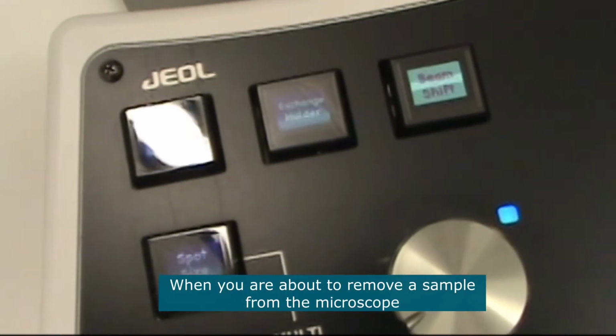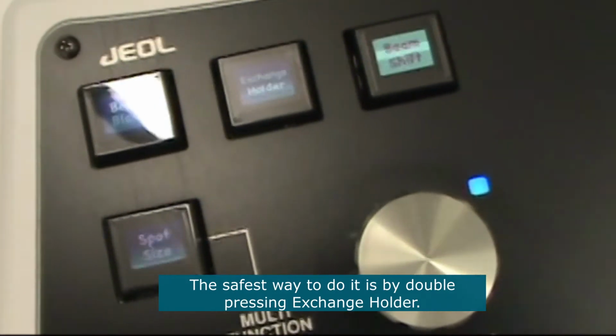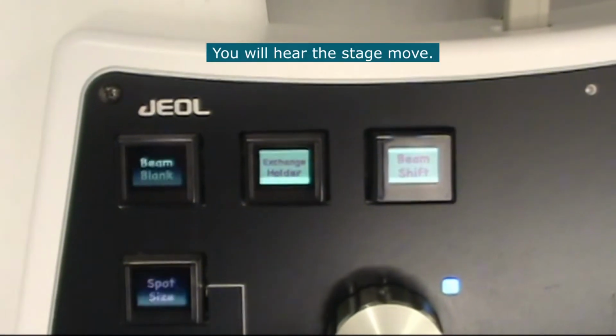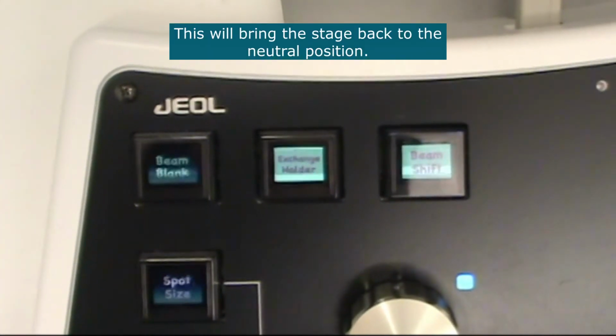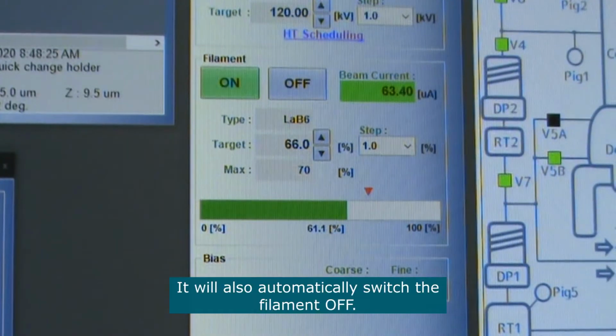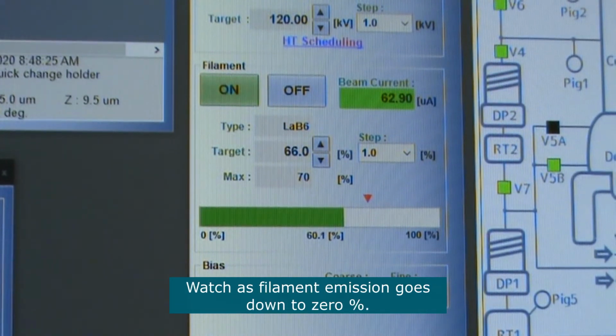When you are about to remove a sample from the microscope, the safest way to do it is by double pressing Exchange Holder. This will bring the stage back to the neutral position. It will also automatically switch the filament off.